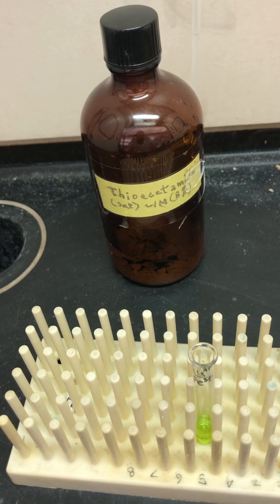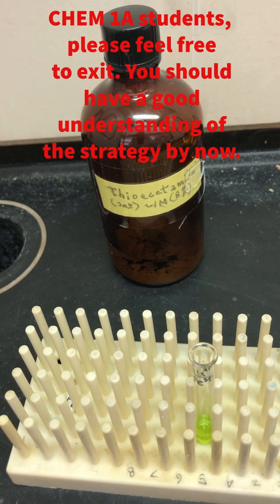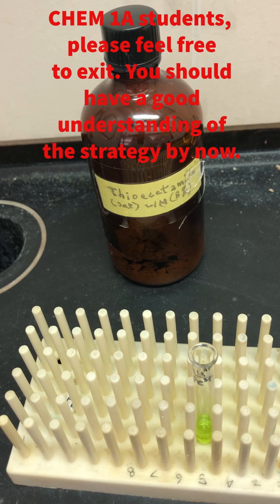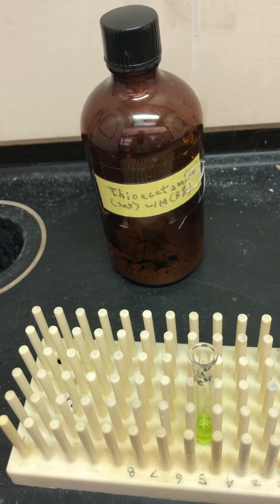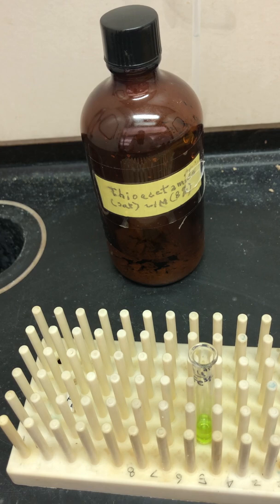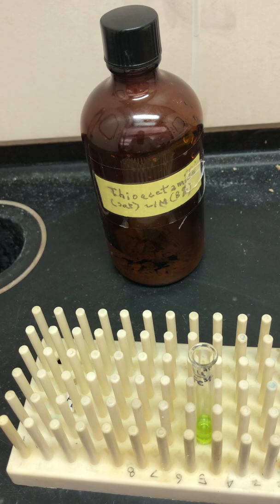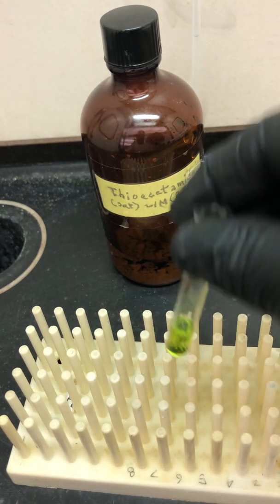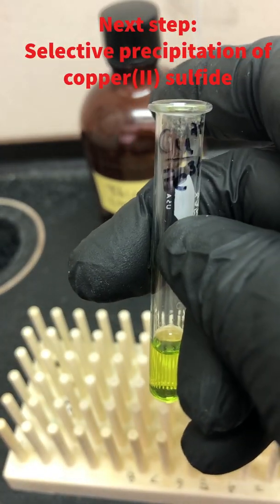Students, for those of you from Chem 1A who are watching this, you don't need to continue. You should have gotten the idea of the strategy behind these sequential precipitations to perform a qualitative analysis separating different cations that were in an initial mixture. For those of you in Chem 1B, you'll understand the chemistry of this later on. But at this point, what we have is our original supernatant, which should have your copper II and iron III ions.